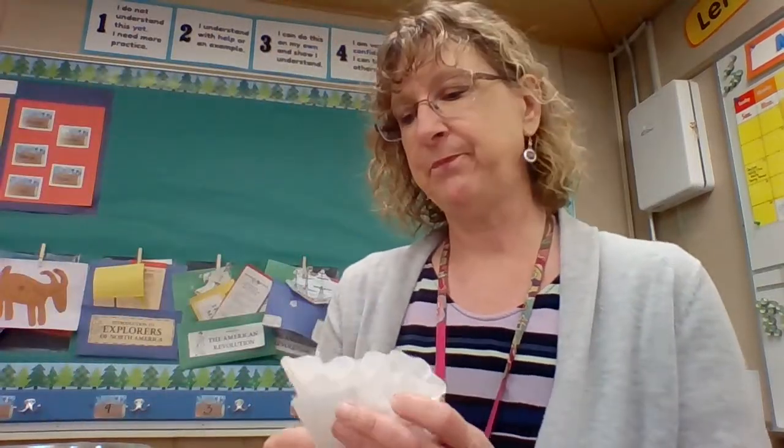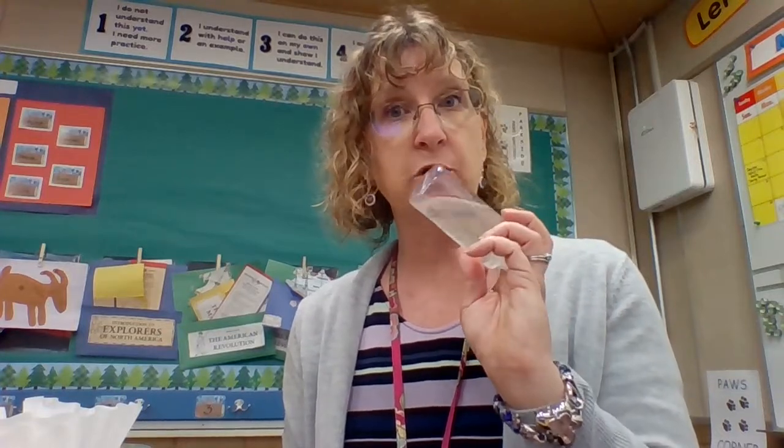That's our saturation point. So I am going to put a filter in my funnel, and then I'm going to wet my filter. And remember, the reason I'm wetting the filter is because I want to make sure that every last drop of the water, or the solution in this case, goes through the filter. If I were to put this in while the filter was dry, some of my solution would actually be absorbed by the filter. So I wouldn't have all of the solution, my 50 milliliters of water plus the solute in my cup. Some of it would be left behind in the filter, and we don't want that.